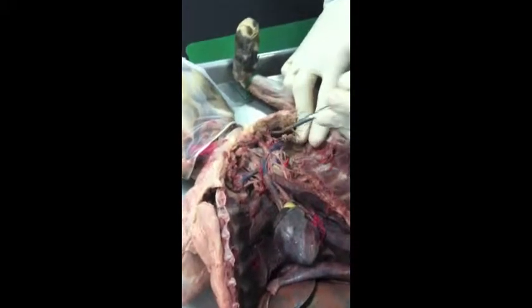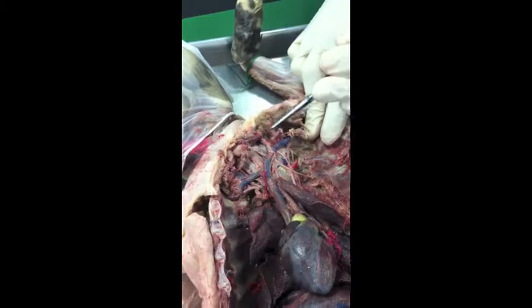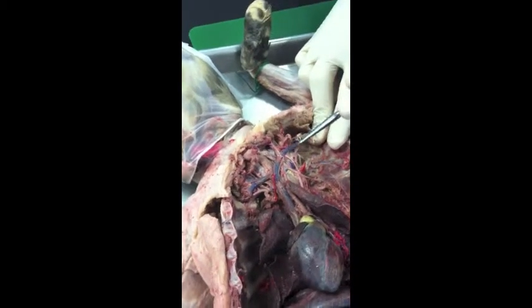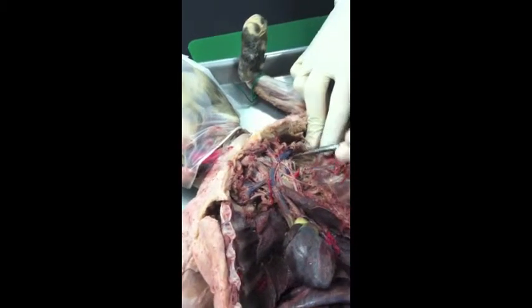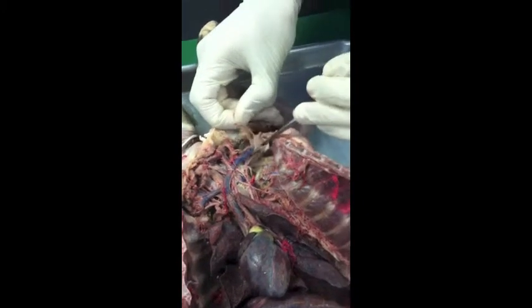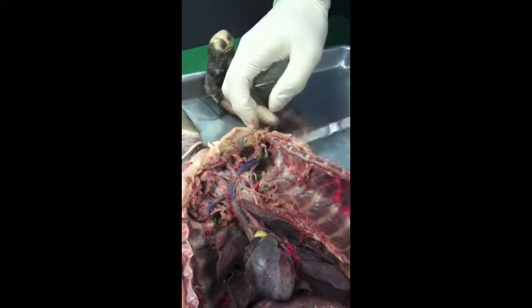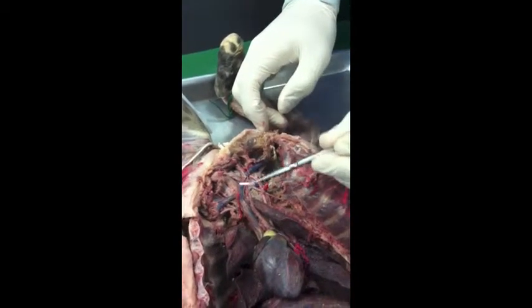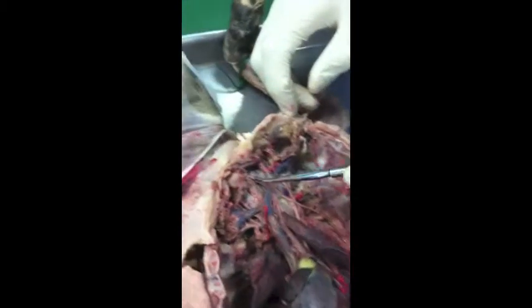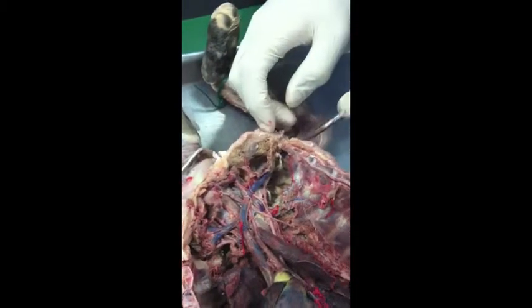Is subclavian. You have a branch going upwards right here, and this one, the external jugular, in between there, that's a subclavian. Then when we get past it into the armpit region, it's axillary, and when you follow the same one into the arm, it's brachial, right? So: vena cava, superior vena cava, brachiocephalic, internal and external jugulars, subclavian, axillary, brachial.